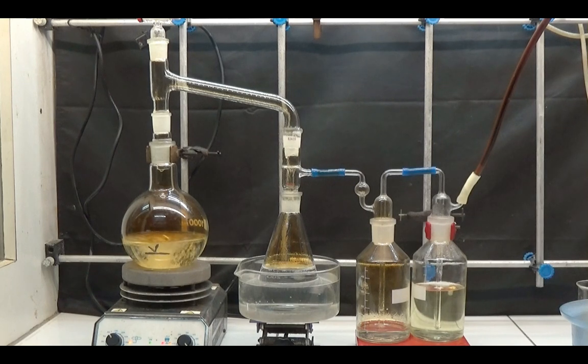To obtain mucic acid by oxidizing lactose with nitric acid, we will assemble equipment that protects against corrosive and toxic gases.